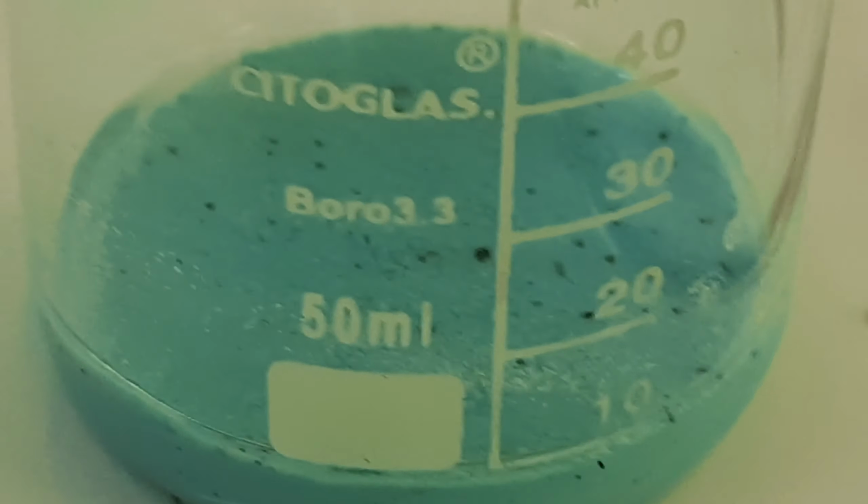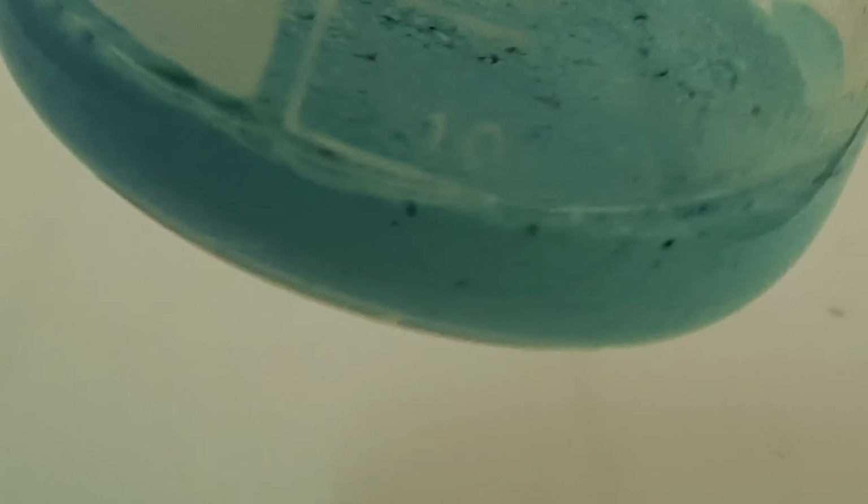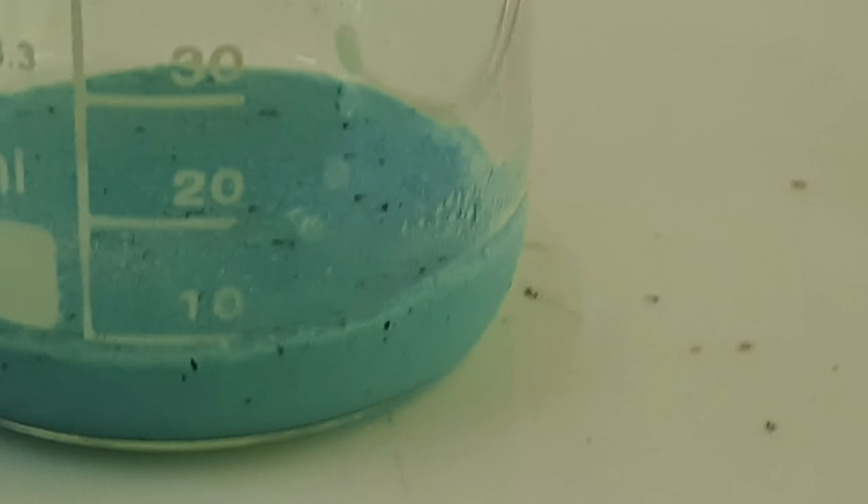less concentrated alcohol solution, wherein the liquid left from the solution after adding copper sulfate is only this little, while most of the water had been reabsorbed by the copper sulfate.